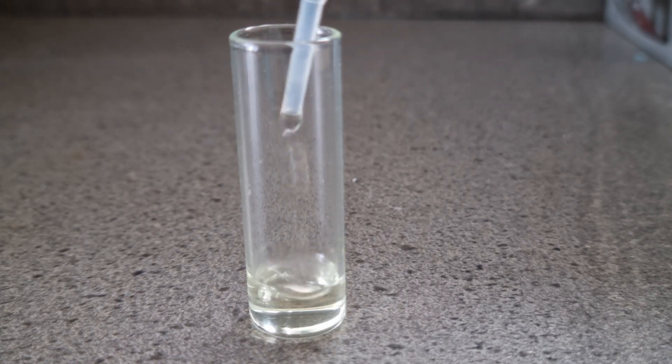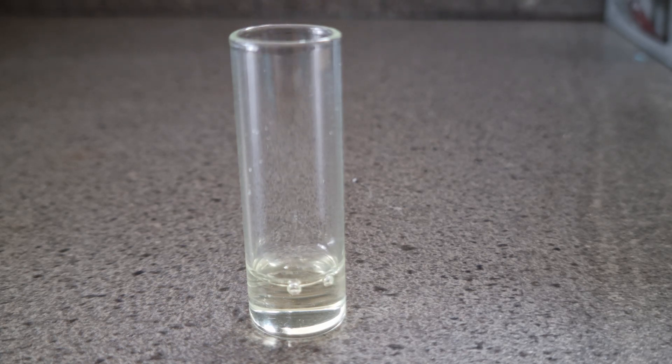Hello there! Today we will try to create the rare ferrate ion in solution.